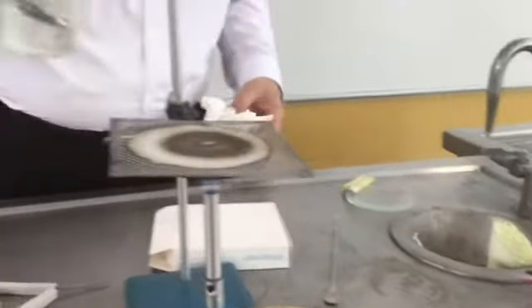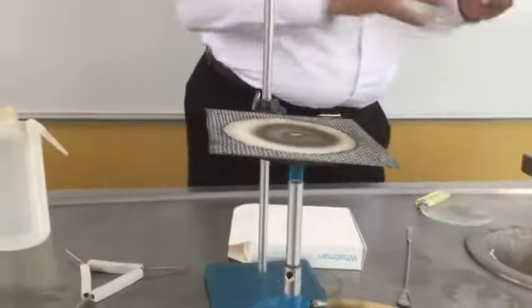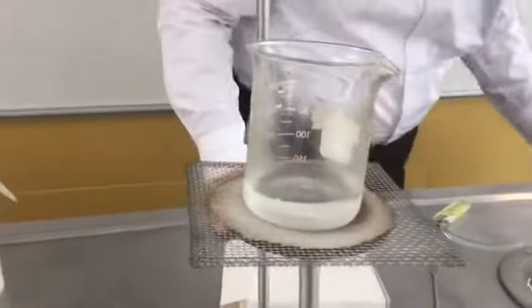Now I am going to change. I'm going to put here the filtrate that we obtained in the first step.